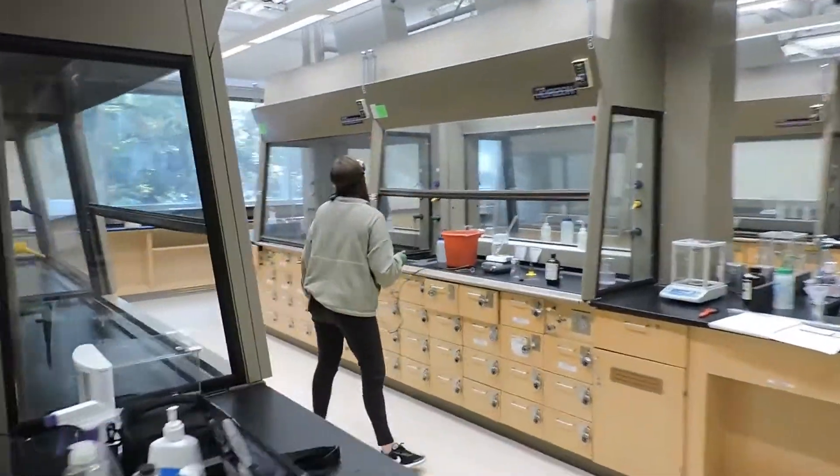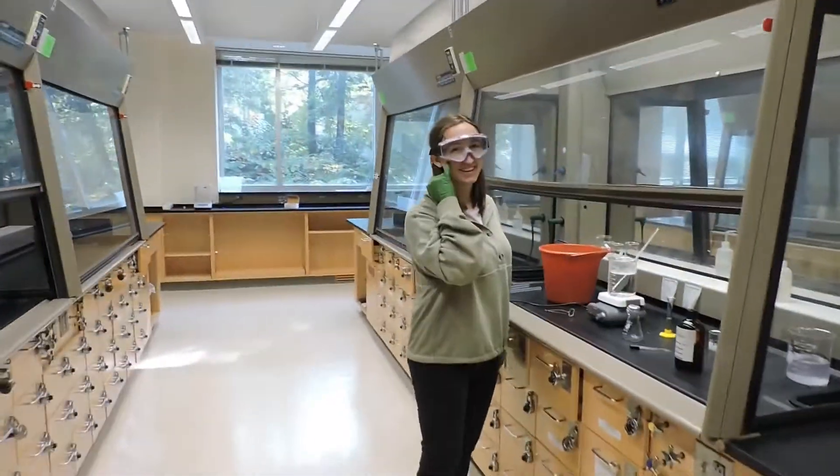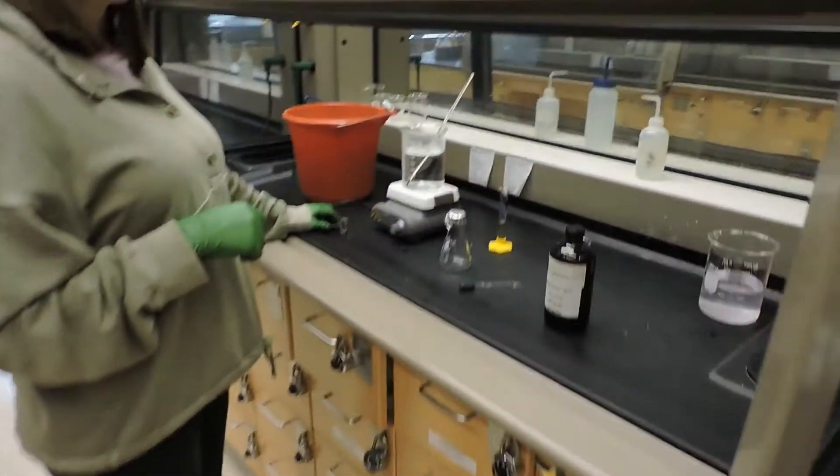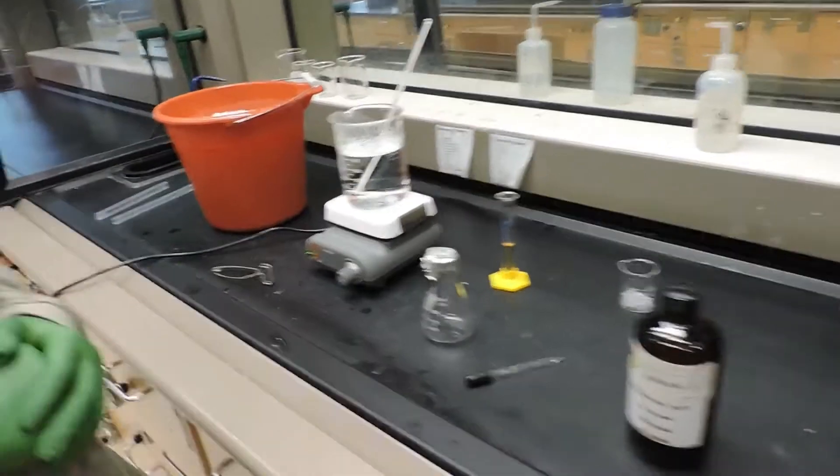All right, we have another glorious day in lab. Today we're going to be doing the ideal gas law molecular weight of a vapor, also known as the modified Dumas method for molar mass determination.